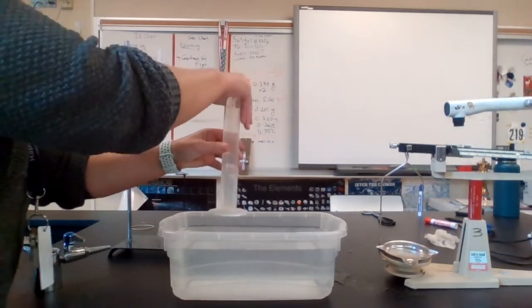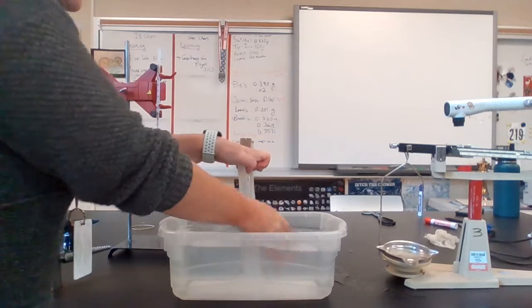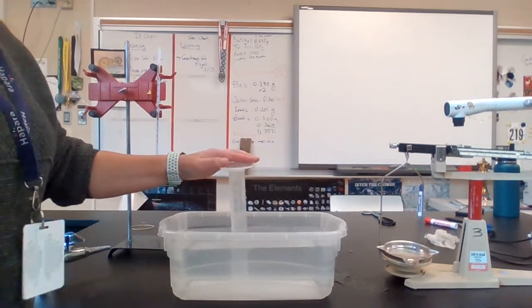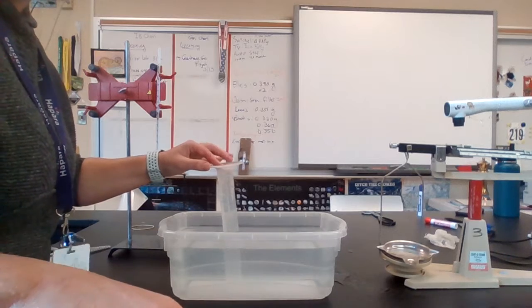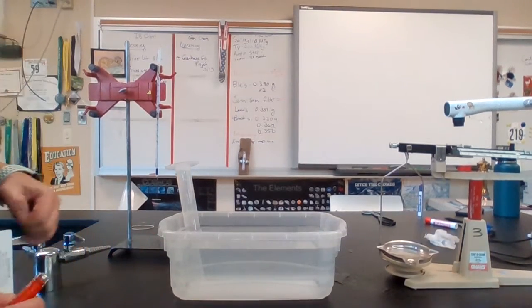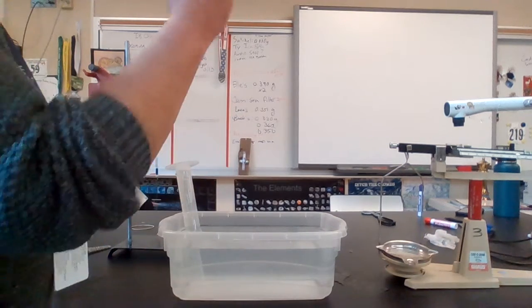It's filled almost to the rim. I'm going to cover it with my hand, put my hand underneath the water, and let that sit for about 5 minutes. So I'm going to pause the video for 5 minutes, and then when I unpause it, you will be ready to move again. Okay, it's been 5 minutes, and now I'm ready to collect some gas.